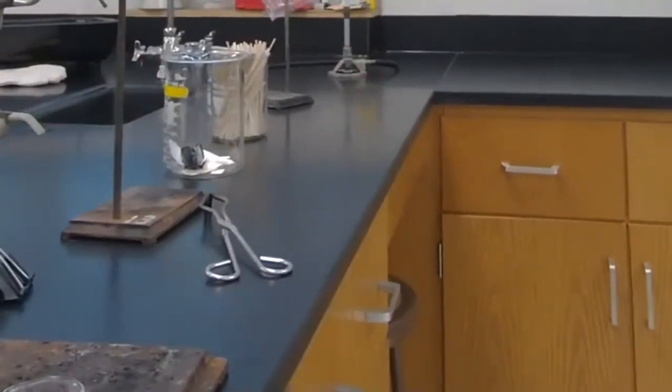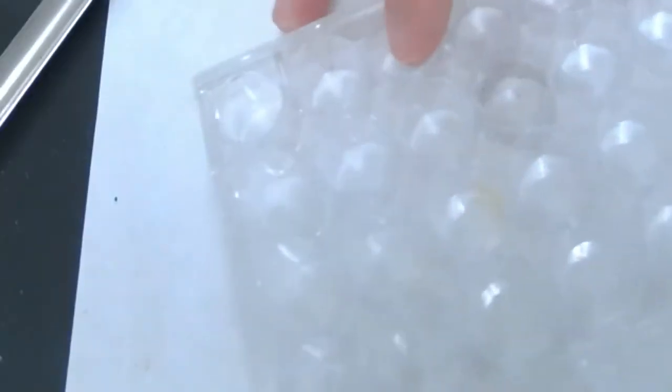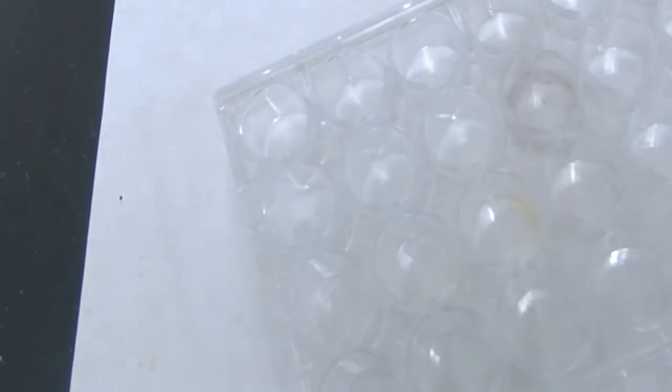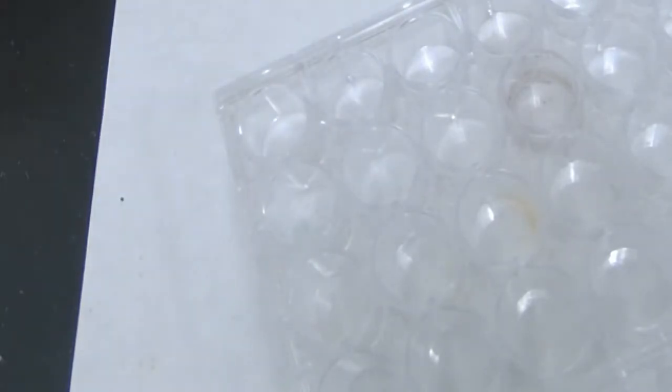So for this next demonstration, pardon the camera motion, I'm going to set her up just above my well plate here. So you guys can see what I got here is my well plate. See if I can angle that a little bit better. Okay. So I got my well plate, and I'm going to add a little bit of this potassium chloride here. Really only want to add a sprinkle or two, not a big chunk. We'll put it in this well here. KCl, potassium chloride. Now I'm going to add a little bit of water to that.